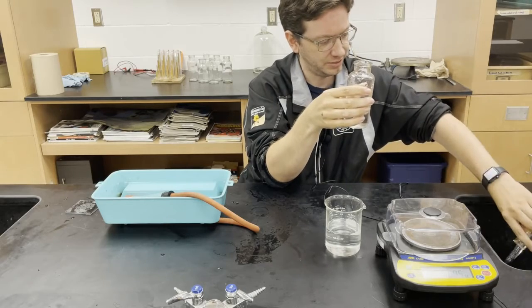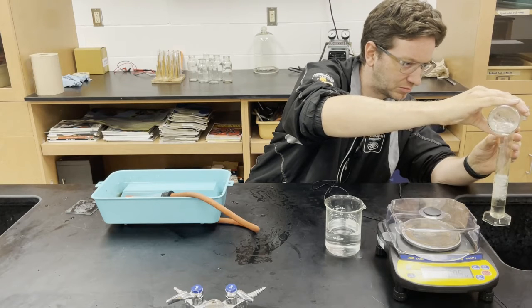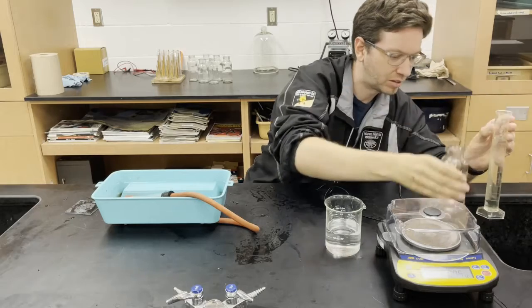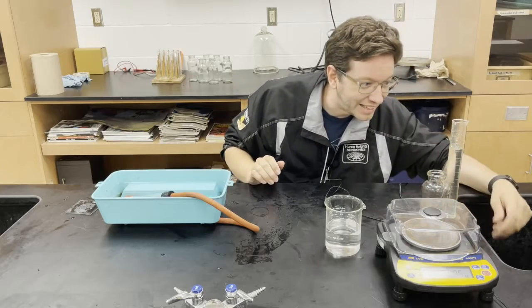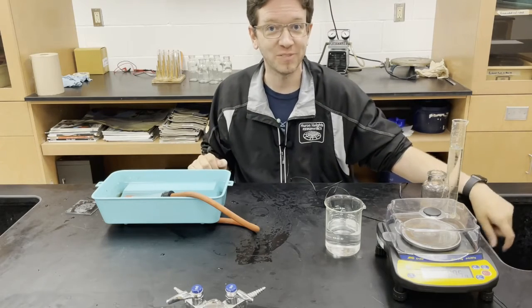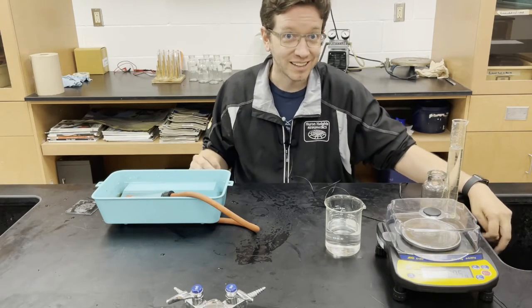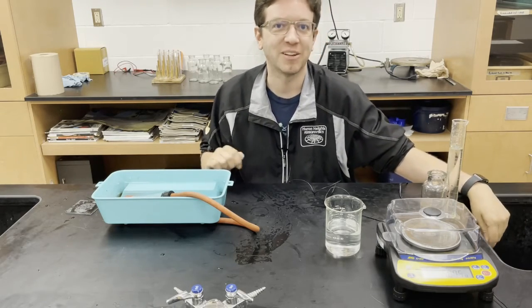There's 100 milliliters. So let's measure the volume of water, and we can use the volume of water to get the volume of the gas. Then you can do the calculations to get the percent composition of calcium carbonate in a Tums tablet. Let me know what you get, and if you want to see me do those calculations, let me know in the comments and I'll make a separate video for that.